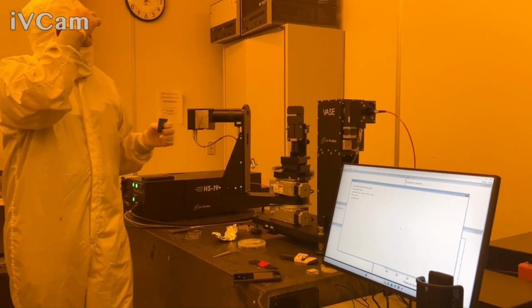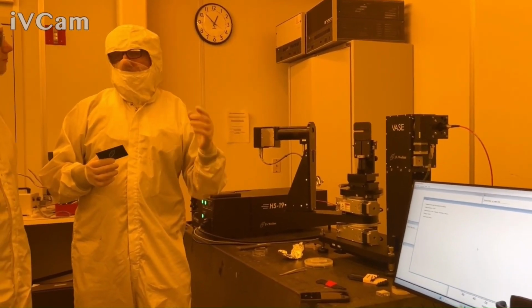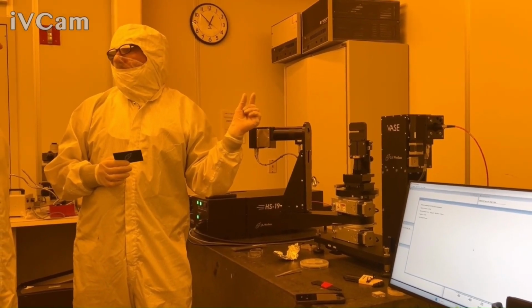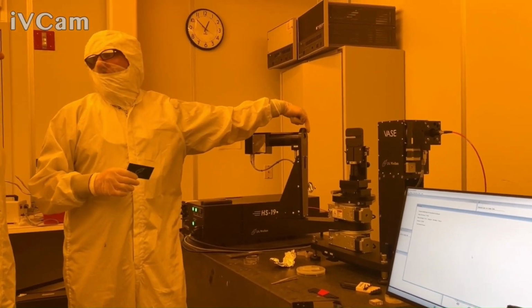The tilt's always pretty easy. Okay, but if you're like, where the heck is it, somebody might have come in here and lined up a 1-inch optic. And then you come in here, you didn't know that. And so when you put your wafer on there, your reflected light might not even come into the receiver.